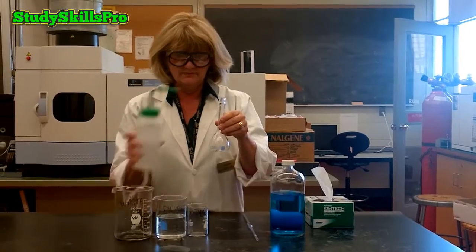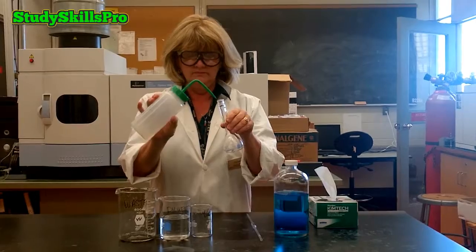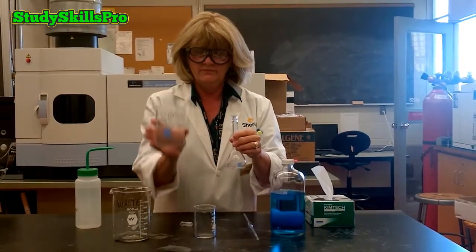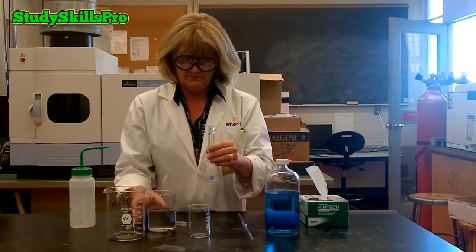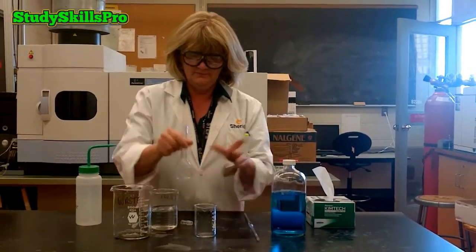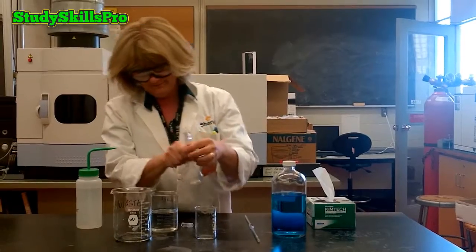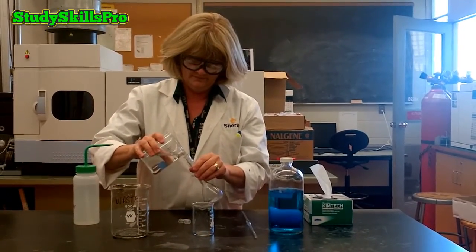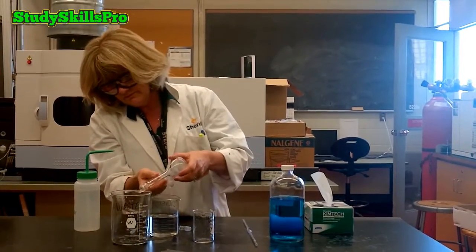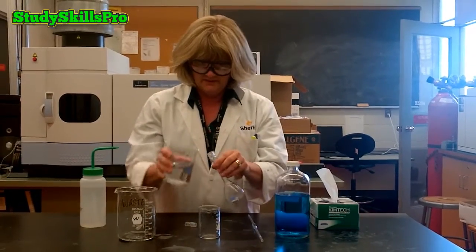The first step is to rinse the volumetric flask 3 times with RO water. We have already rinsed our volumetric flask 3 times with water. The final rinse of the volumetric flask must always be with diluent. This is the solution that you are going to fill the volumetric flask to the mark with. You must rinse your volumetric flask 3 times with the diluent. Each time, you can transfer your rinse to a large waste beaker.